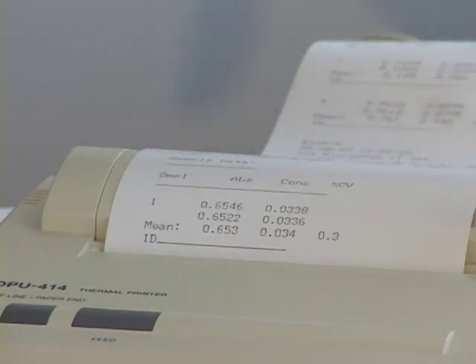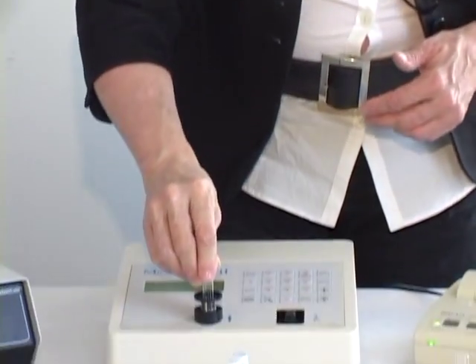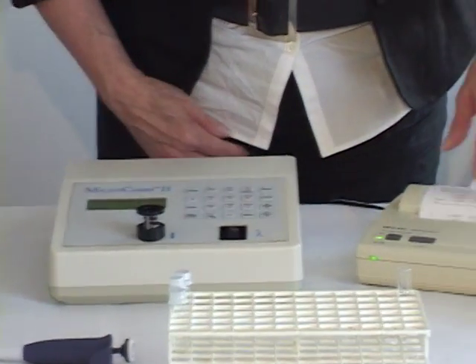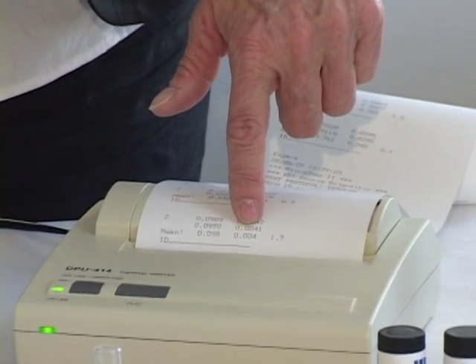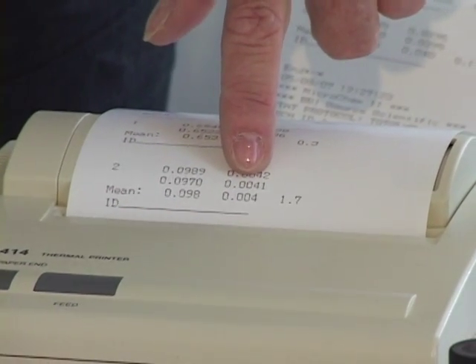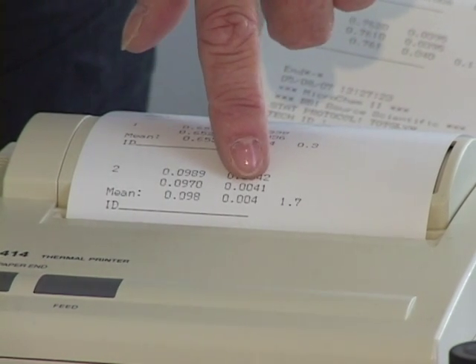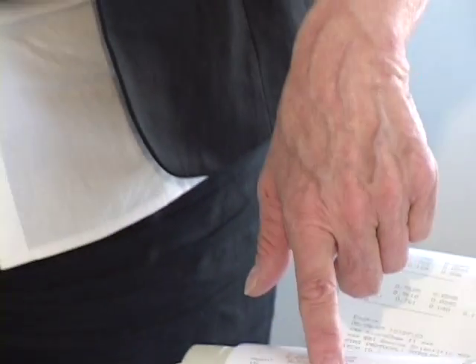Let's look at our very pale sample, much more typical of what you might expect for a biodiesel sample that is high quality. We will read this sample. This will be our sample number 2. And this concentration, in fact, is 0.004. For a 1 to 10 dilution, that's a resultant 0.04% total glycerin. Excellent, high quality biodiesel with low total glycerin.